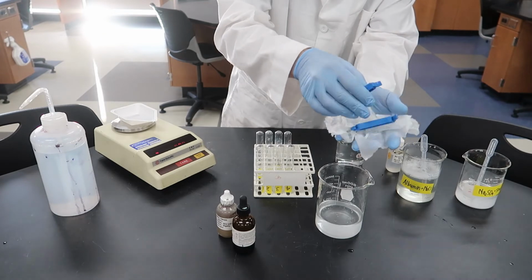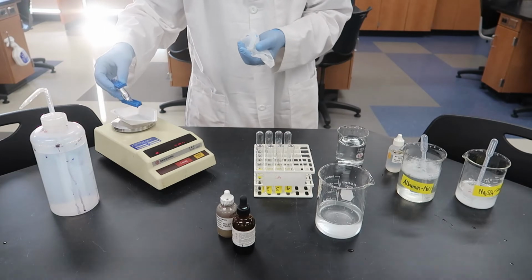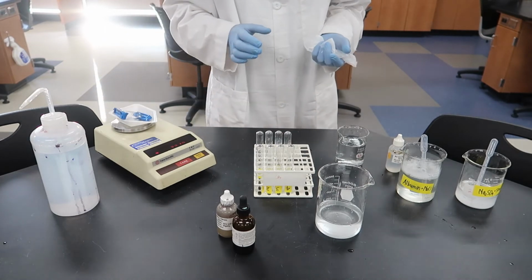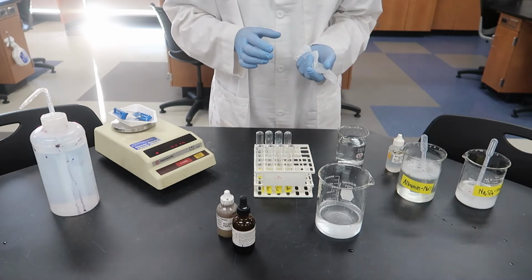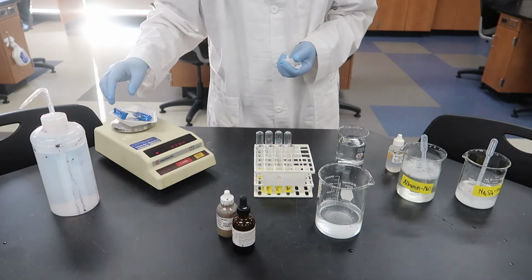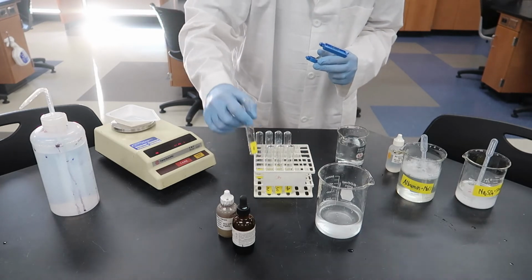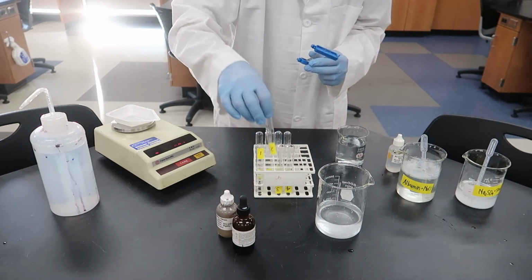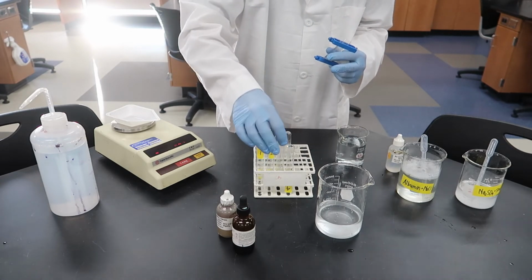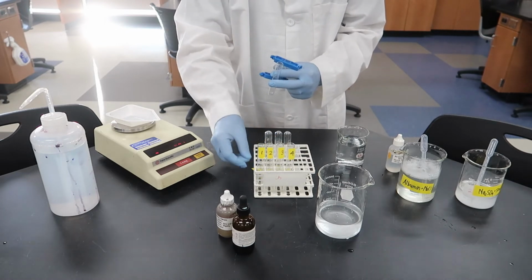Some students have asked in the past if the movement of solute molecules would affect the mass, but it really won't. But the movement of water will. All right, it looks like our mass is 22.19 grams. Might be 22.20, kind of wavering there, but we can go with 22.19. Okay, so you'll need to compare that to our initial mass and determine for yourself what happened. Did the mass go up? Did it go down? And what does that mean?